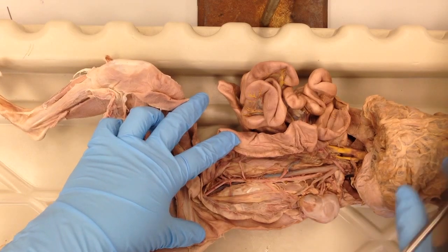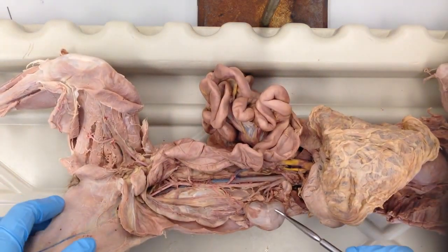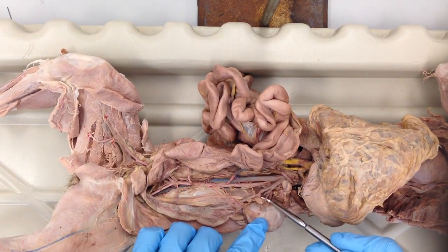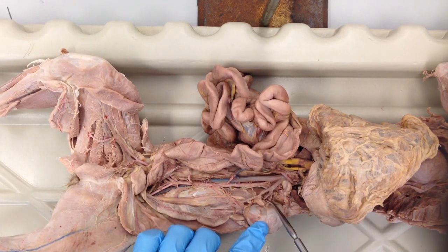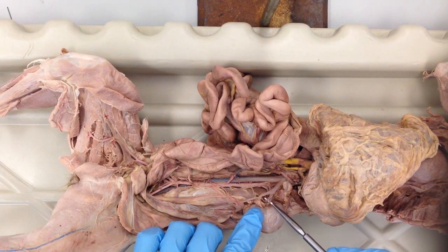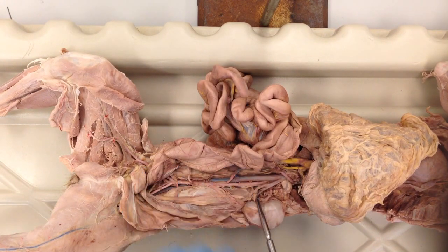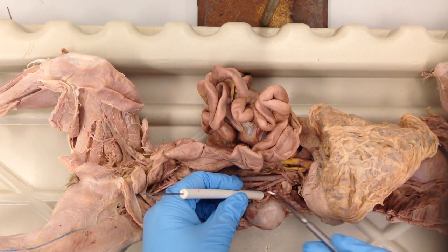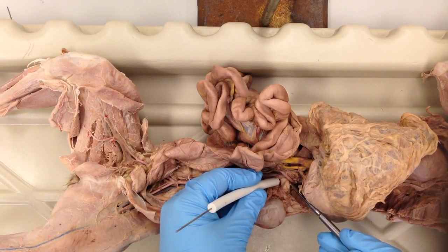We'll go back up and just quickly review the renal artery and vein. This is the kidney here, and of course there are two kidneys, one on each side, and you have the renal vein here, and it may be branched. In some kidneys, the renal veins and arteries branch before they enter the kidney, and this one looks like it's branched. Deep to that renal vein, we have the renal artery. So there's the renal artery and then the renal vein. And this, just for reference, is the adrenal gland.